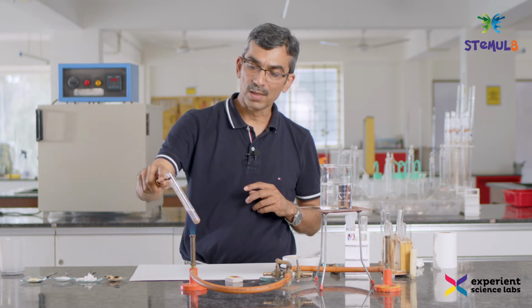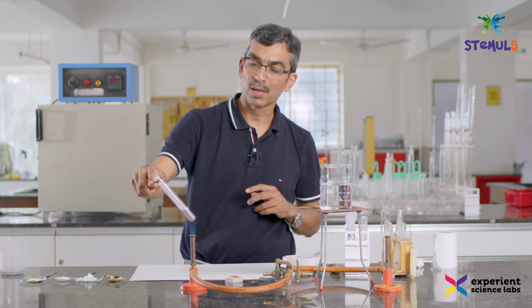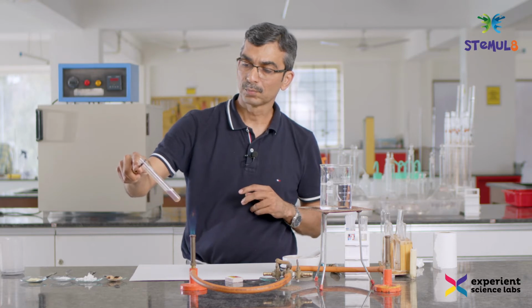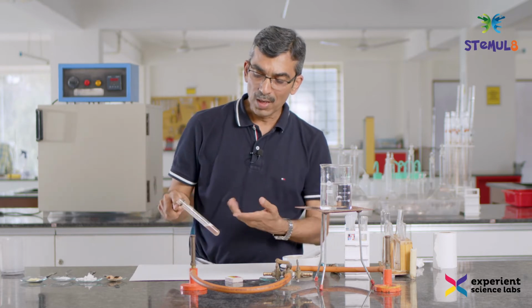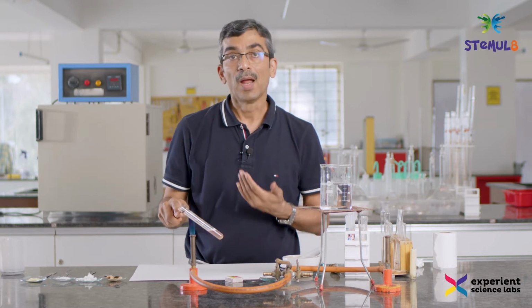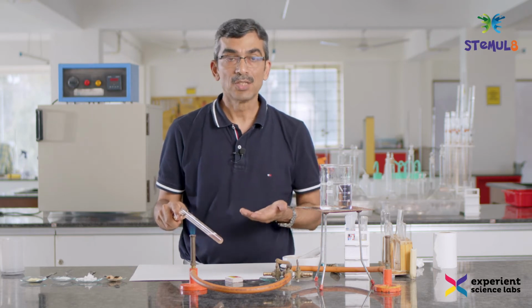As you can see, the color is turning purple. As it's heating up, it is getting darker and darker. So as you can make out, the color has turned from blue to purple, and when biuret reagent is added to any food and the color turns purple, it indicates the presence of protein.